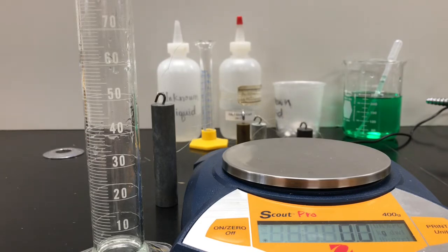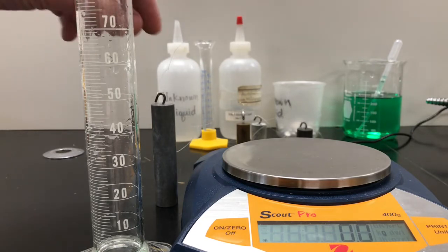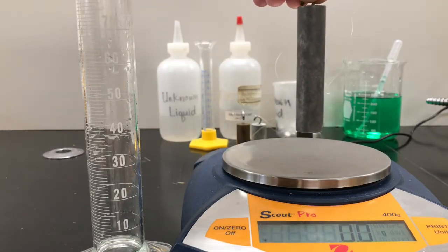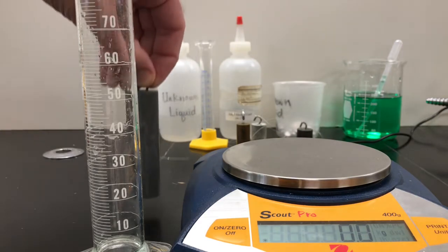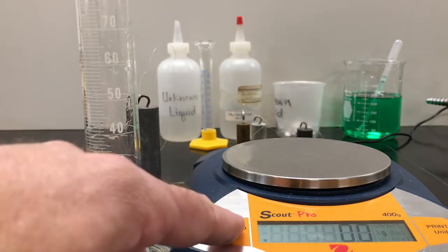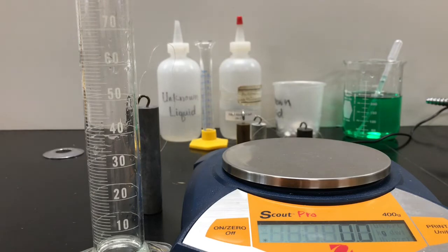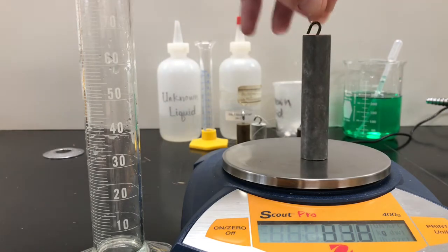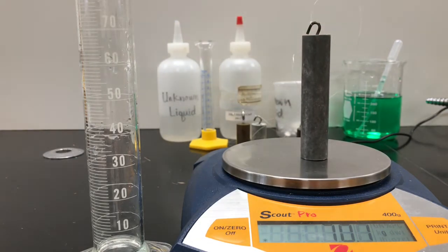So the first thing we want to do is find the mass of our sample, our aluminum cylinder. Now we do have a little bit of fishing string, but that's not going to create any major mass. Before we put our object on the scale though, we should always hit the re-zero button to make sure our scale is properly calibrated. And then we can put the sample on the scale and we can read it. It's a little tough for you folks because it's a little angled, but it is 70.1. So the aluminum cylinder is 70.1 grams, and you'll see the little g for the units there.